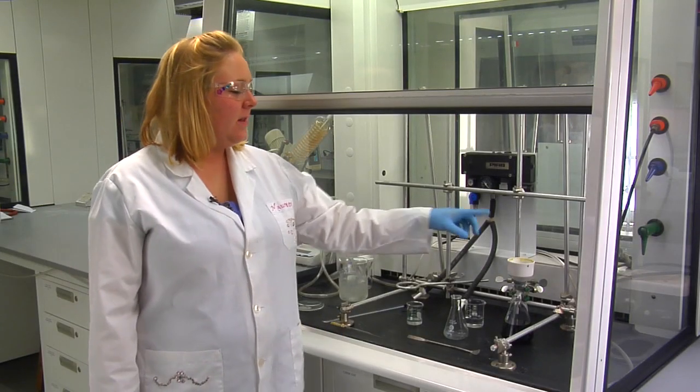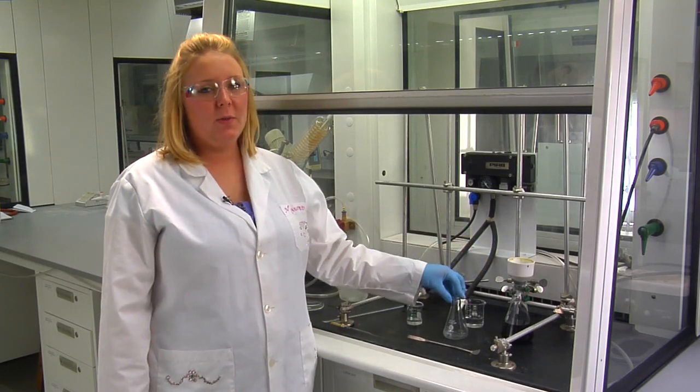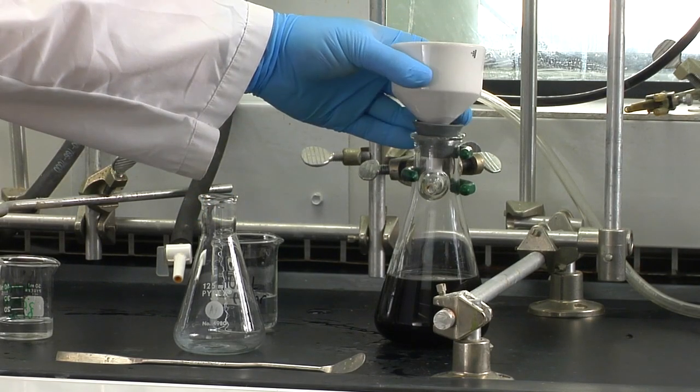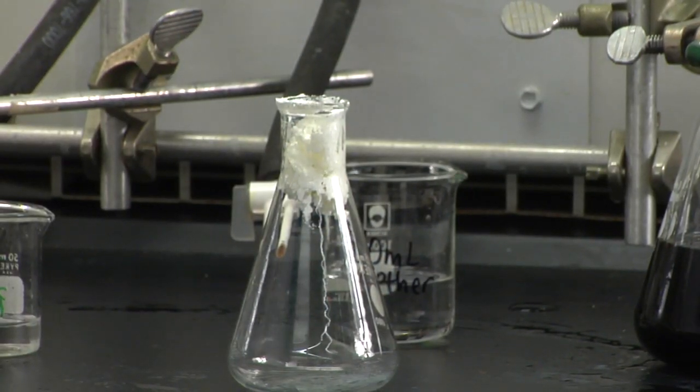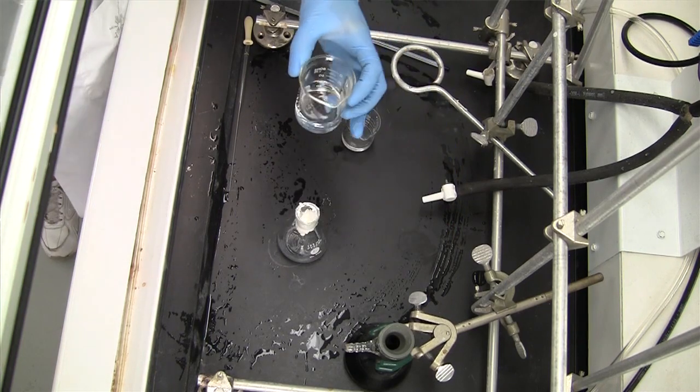We're now going to transfer all of your product into a 125 mil flask and we'll add 40 mils of ether.